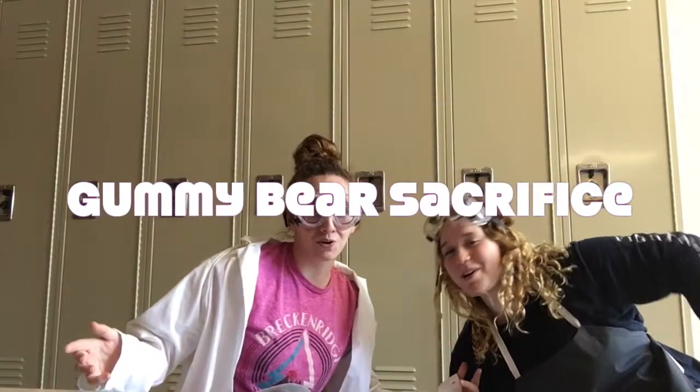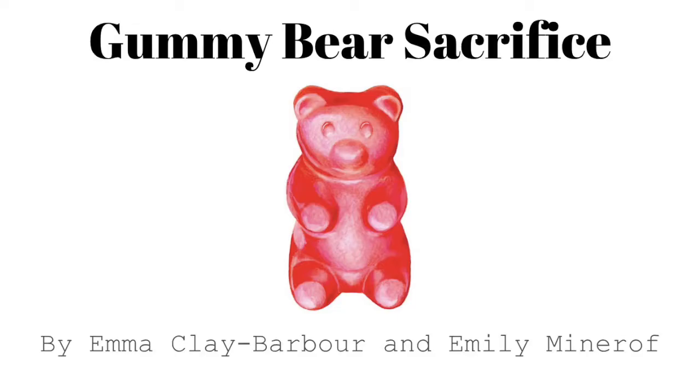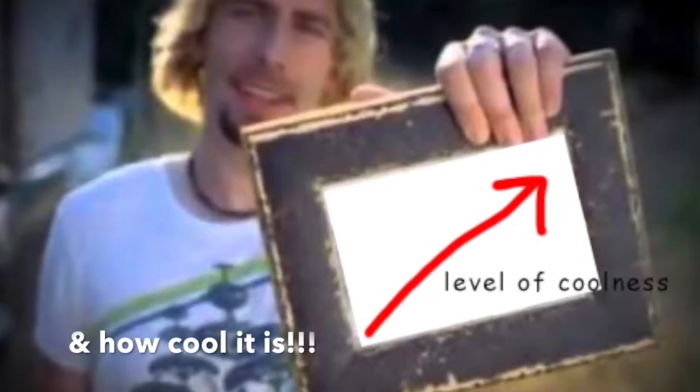Hello, and welcome to our Gummy Bear Sacrifice. Today, we'll be reacting potassium chlorate with a gummy bear containing sucrose, or sugar, in what is called our Gummy Bear Sacrifice. Here's a breakdown of the reaction. Look at this graph!